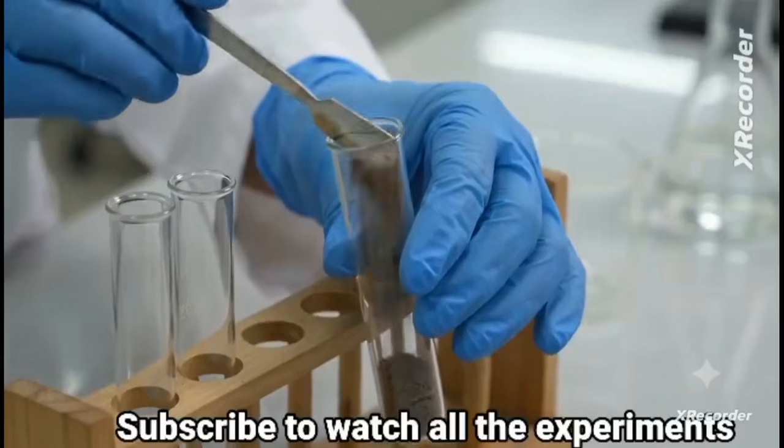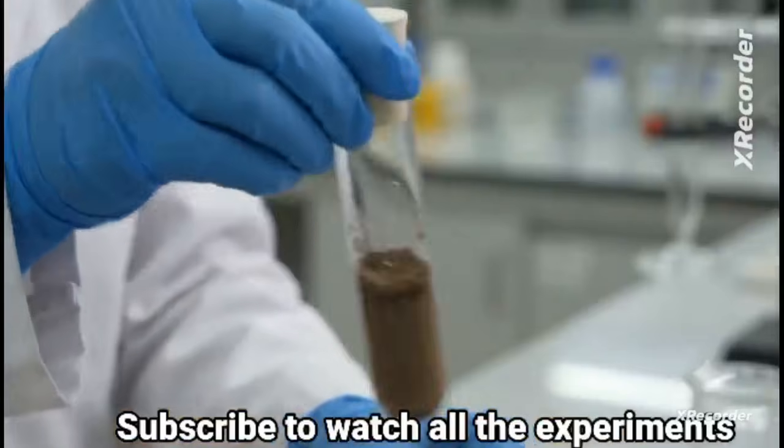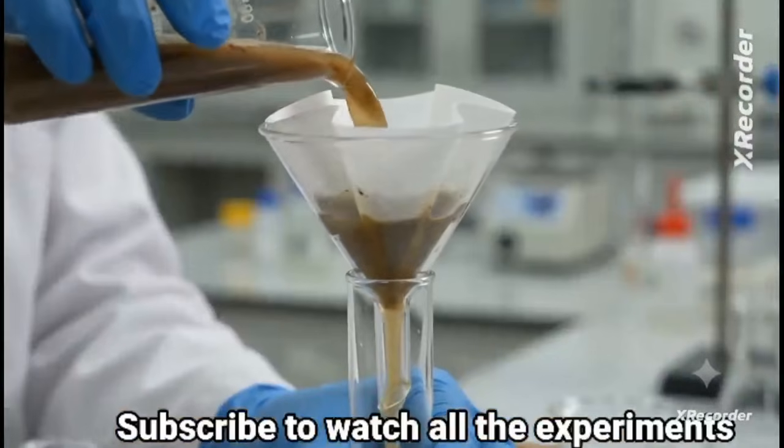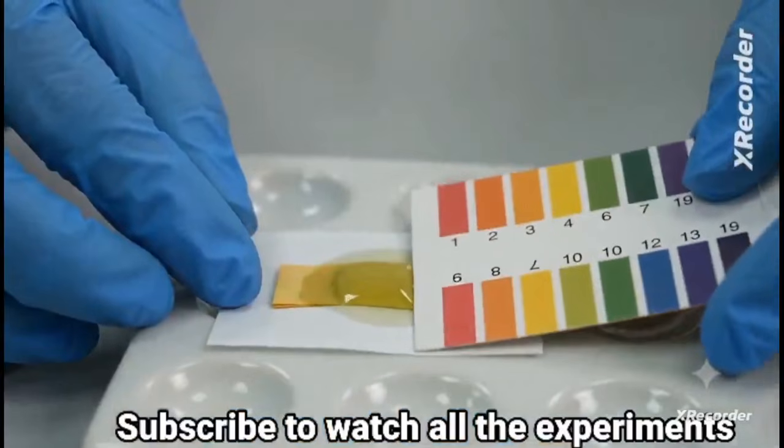Add 2 grams of soil to a test tube. Now add 5 ml of water. Shake the contents well and filter it. Collect the filtrate in a clean test tube. Check its pH with indicator paper. Match the color with the chart.